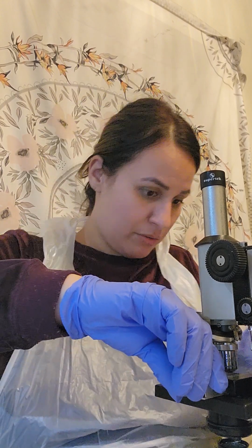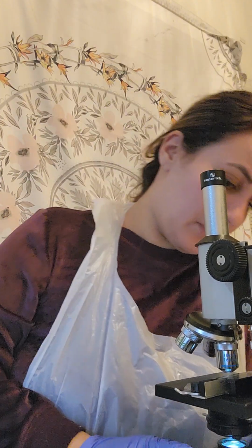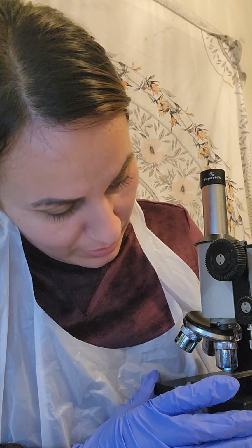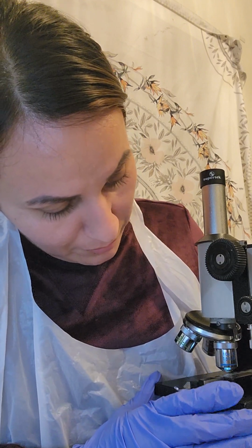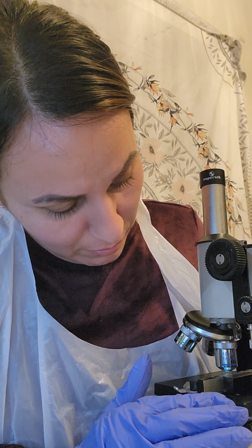Okay, so the next step, focus and using the microscope. Identify the letter E in your slide box. So I have my slide that I already have taken out, so I'm going to put that under here. Alrighty. I'm going to turn on the light, and immediately I can already see that I'm going to need to move this slide around to get it in focus with these little turn knobs that I have here.